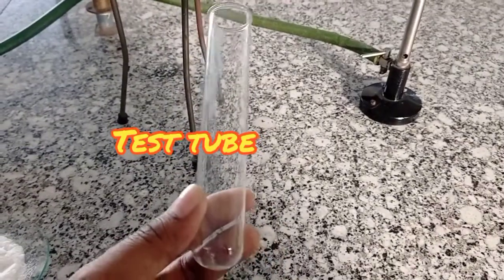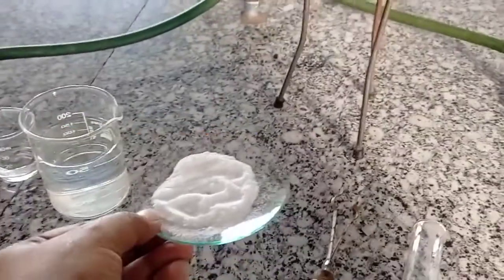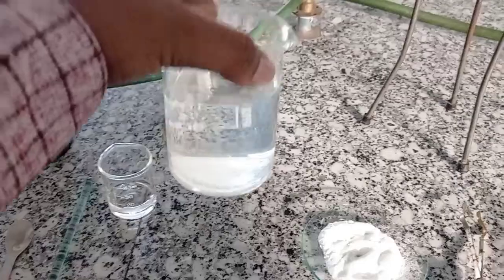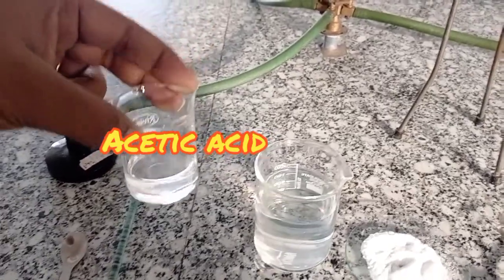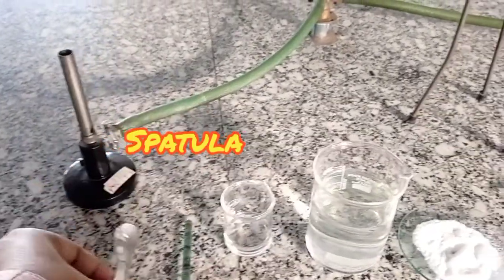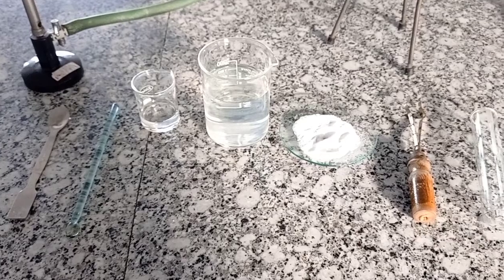For today's demonstration I require: one test tube, test tube holders, sodium bicarbonate salt — you can see this is sodium bicarbonate — distilled water, and acid. Here I am using acetic acid. I also require one stirrer and one spatula. These are the things I require for today's demonstration.